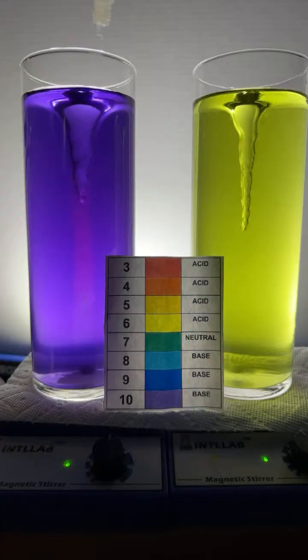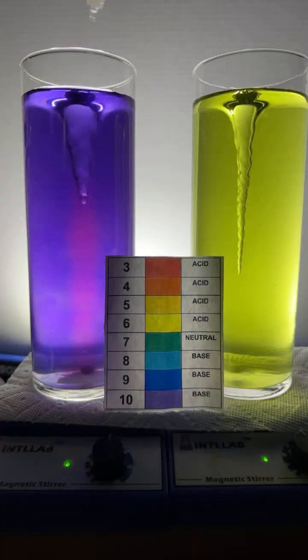Can I change it to every color, says Edward. Let's give it a shot, Edward. Come on, baby.